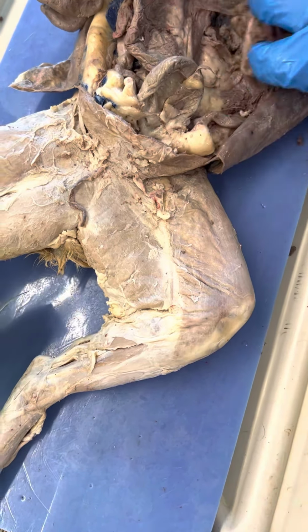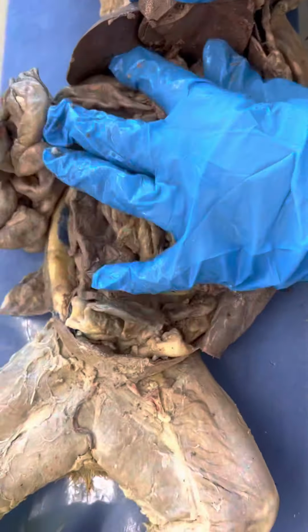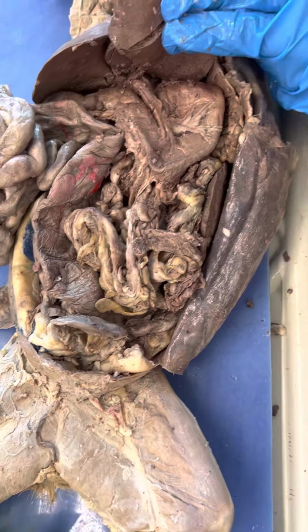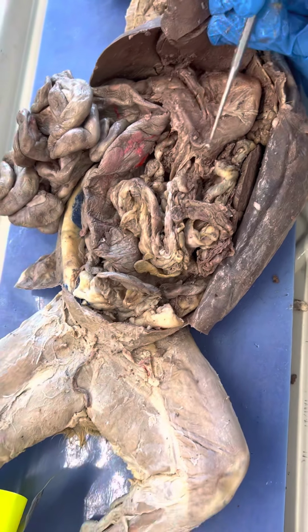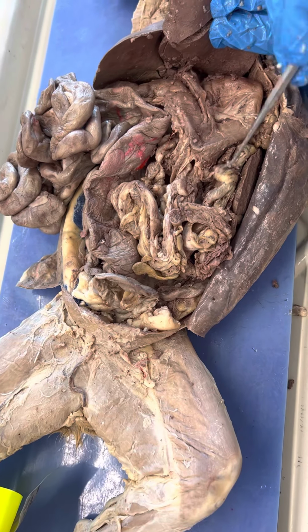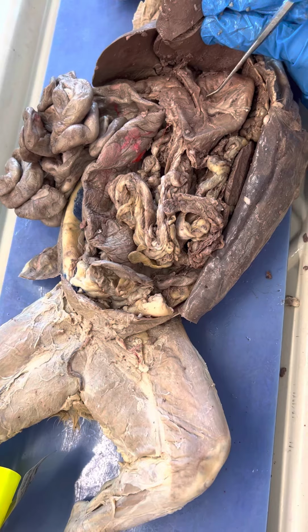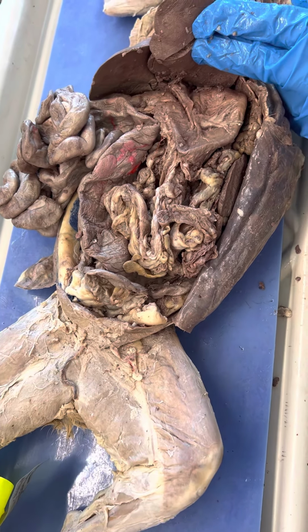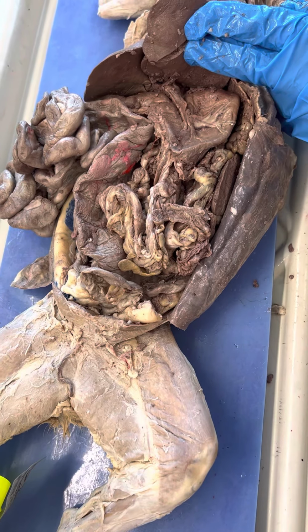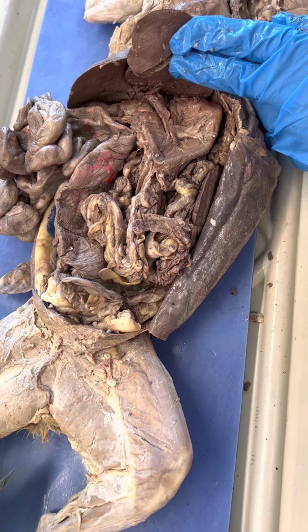Okay, stomach. Do you think it'll be too hard? Your stomach is right here. My impression is that you're going to have to know the parts. This is the greater curvature. The greater omentum comes off the greater curvature. This is the lesser curvature. The lesser omentum comes off the lesser curvature. That always helped me to remember where they were, because I'm linking the parts together. And if I'm not sure, I can come back to it.